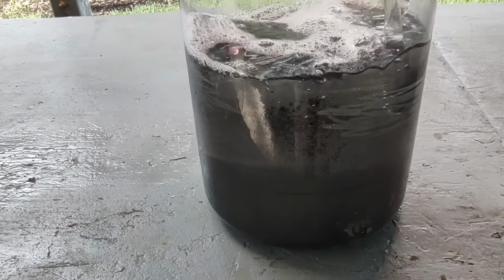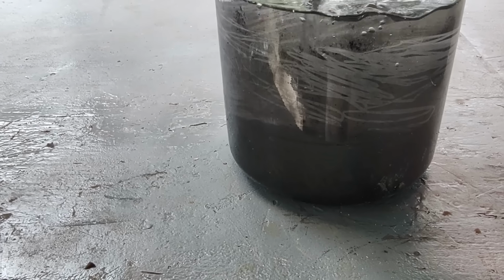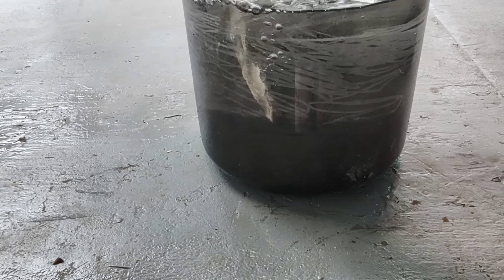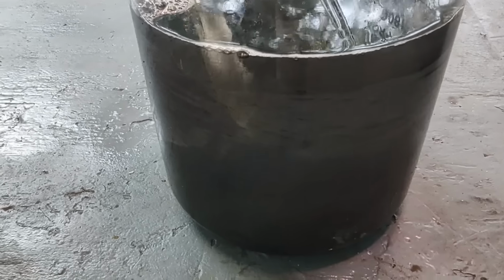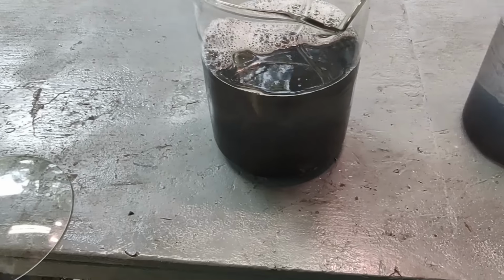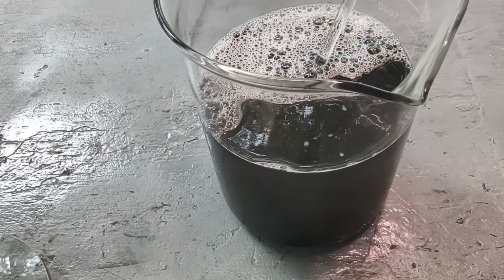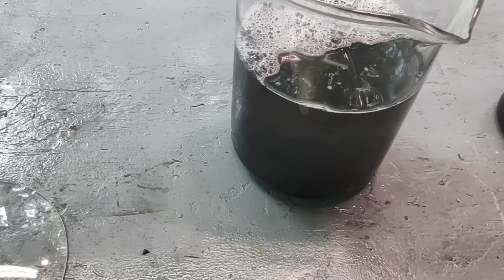There's a lot of stuff on the side of the beaker, which is why it doesn't look so clear. I have to get that stuff off and let it settle to the bottom. And speaking of settling to the bottom, there is a lot of palladium on the bottom of this beaker. It may even be more than in this one. I don't know why. I put half the liquid in here, the other half in here, and we had a big boil over and lost some of the palladium, but there seems to be a lot of palladium in that beaker. I'm very happy about that. We're going to have some losses, but there's a lot of palladium here.